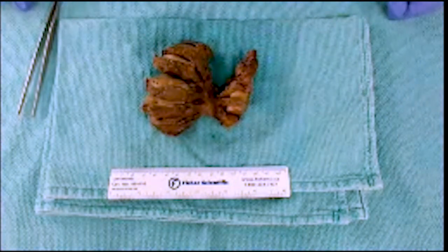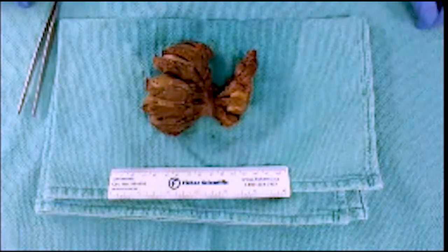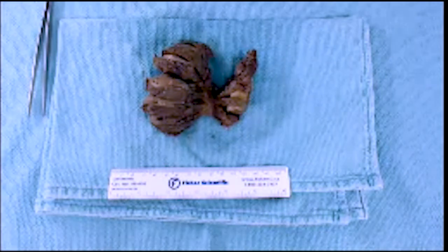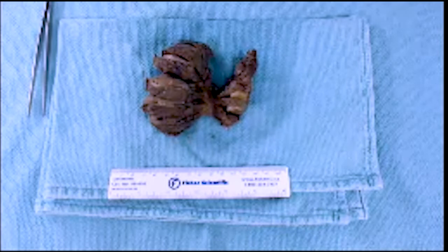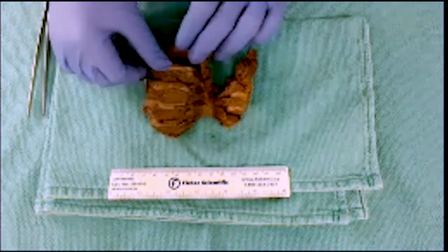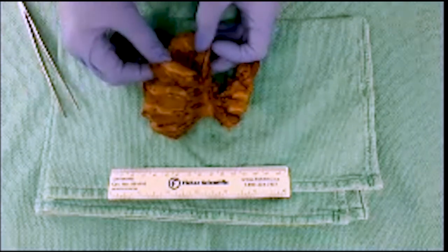In this case I would definitely be consulting the pathologist because it is quite a large specimen, and if they were not available I would be on the more conservative side and submit the entire capsule of the lesion. The lesion had suspicious papillary features, so I would still want to heavily sample the capsule and show all the different areas within the mass — including that cystic area as well as the more homogeneous areas.